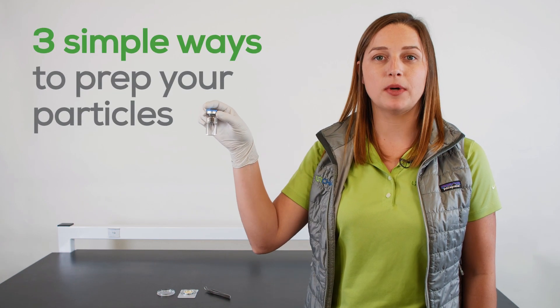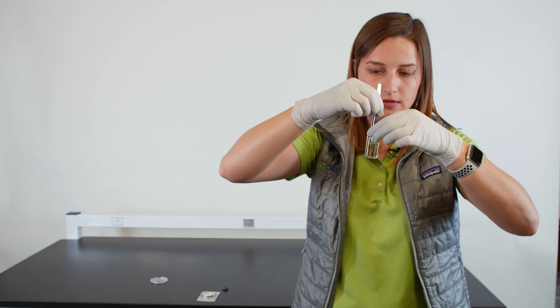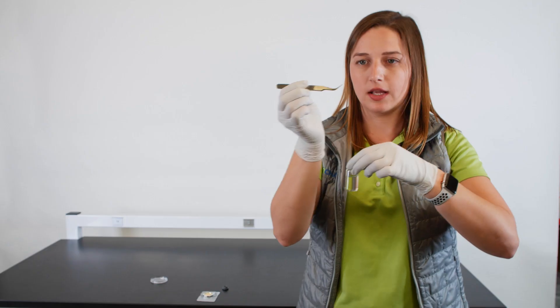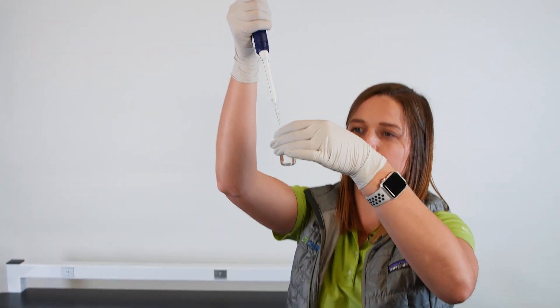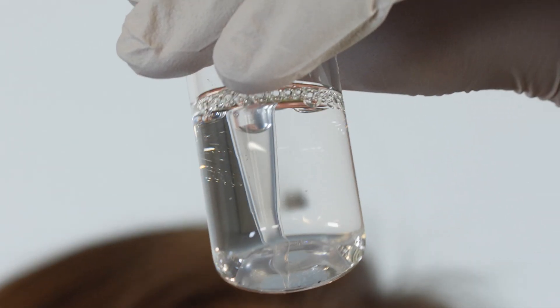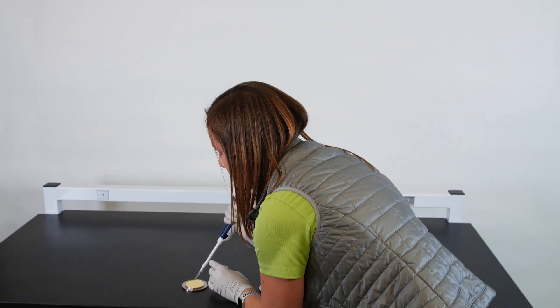Let's get started with three simple ways to prep your particles. If the particle is large enough, you can just pluck it out of the vial and place it on the filter round. If the particle doesn't appear to be very solid, I can pipette it out of solution to keep it in suspension during identification.